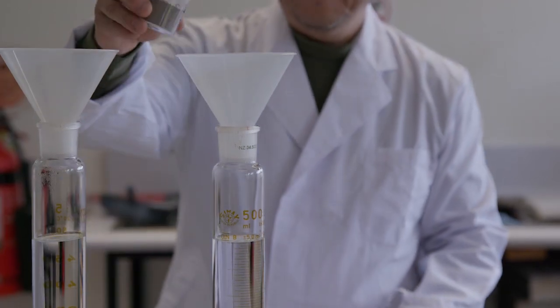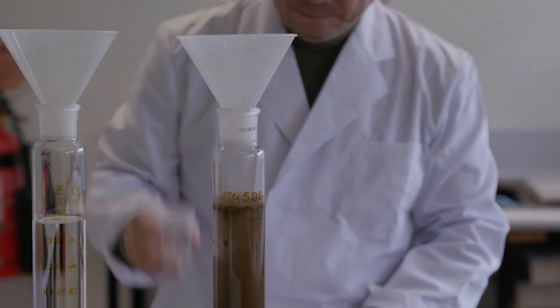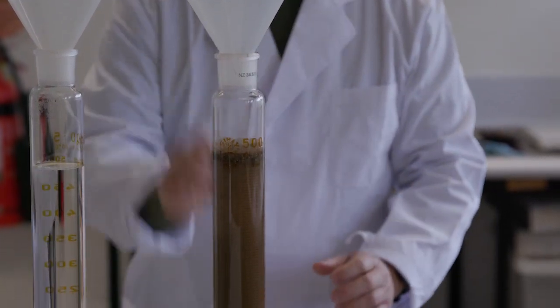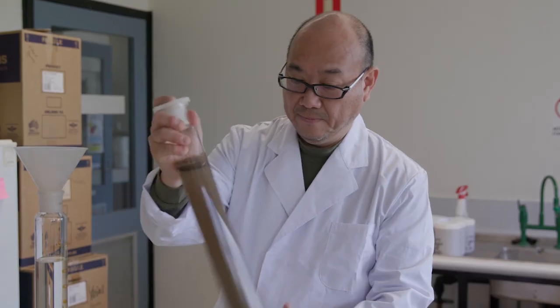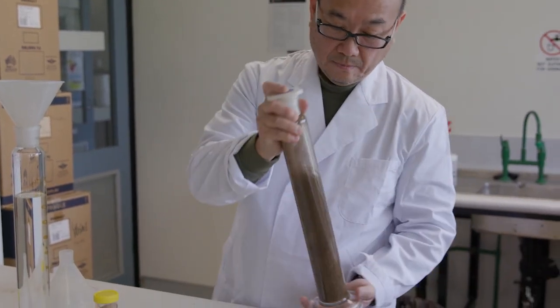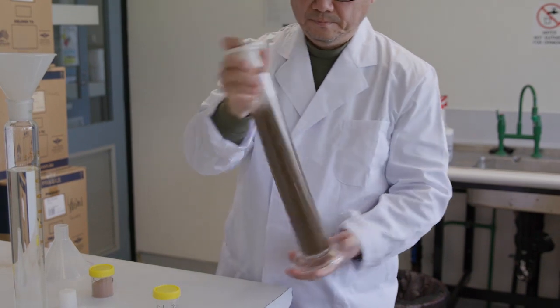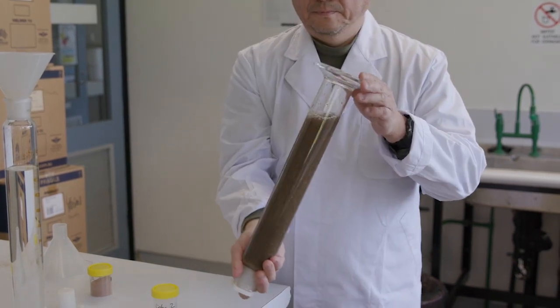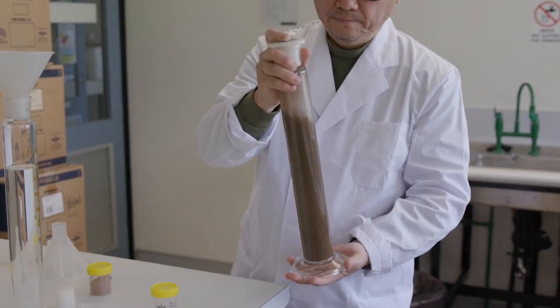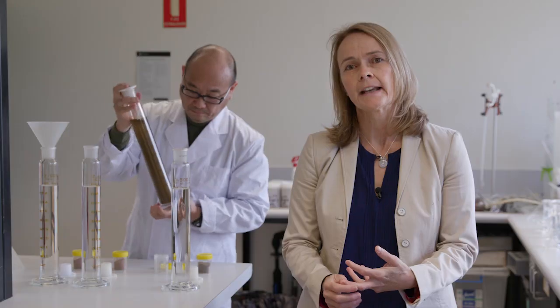In the demonstration behind me, we have water being added to different soils which are from an agricultural cropping paddock, and we are floating off that organic matter in water, mixing it up to see what proportion of this soil is clay, which proportion is silt, and which proportion is organic matter.